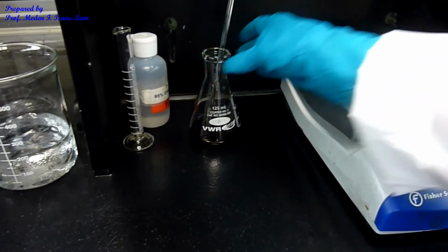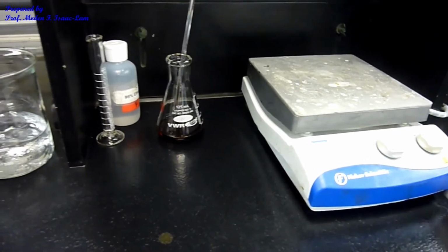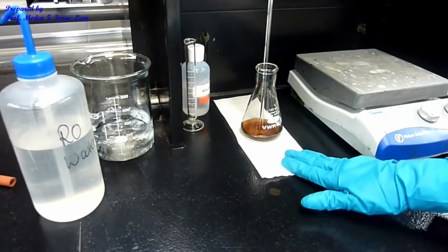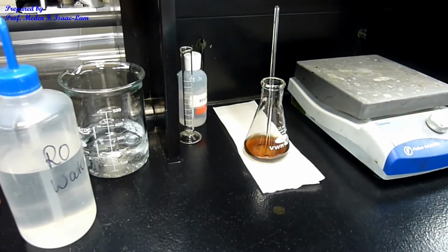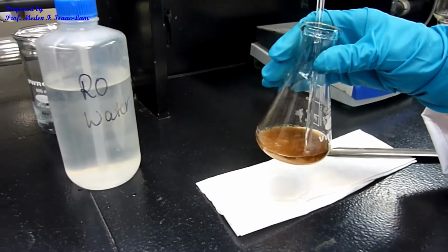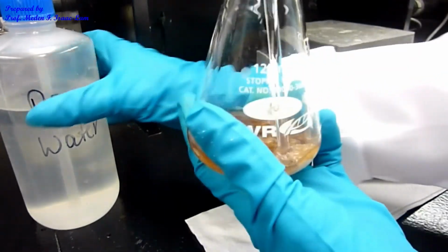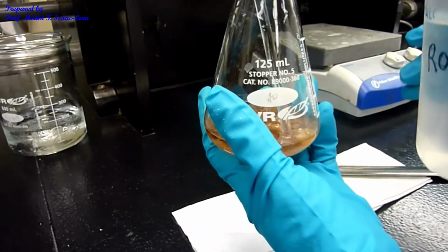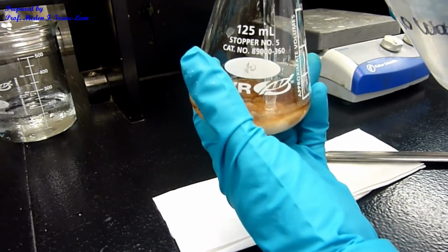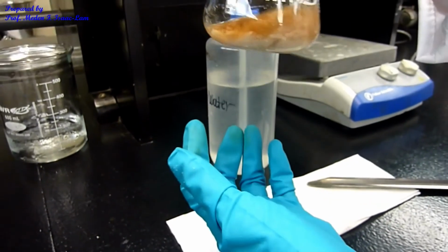And then we would like to see if it would actually crystallize out, and then we will initiate crystallization, because remember, we had a solid, right? So we're going to let it sit, let it cool, and then we're going to initiate crystallization later on. This is the amine and it actually started to precipitate out, so I can add more water. So I added a little bit of water. It started to precipitate out, and then I'm going to add water again so the precipitate comes out.